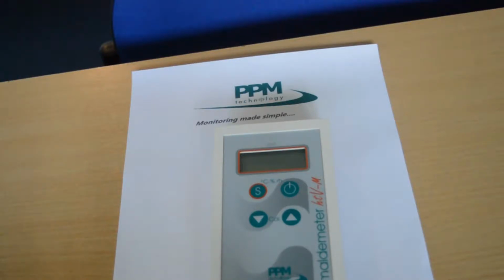There are a total of 4 limits available. These limits are: Limit 1, the default setting for the formaldemeter. Limit 2, the glutaraldemeter mode, which should not be used. Limit 3, used if the formaldemeter is regularly sampling concentrations of formaldehyde in excess of 2 ppm, allowing the instrument to sample at more regular intervals than in the default limit setting.